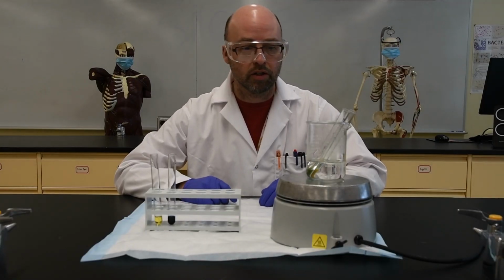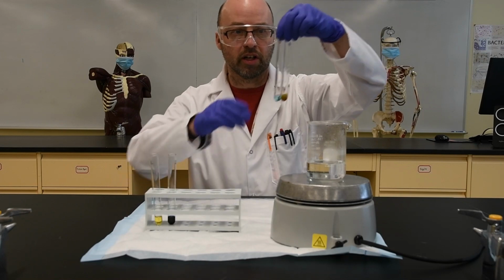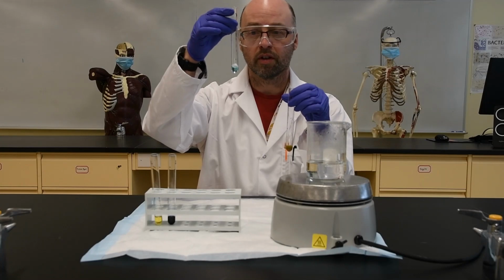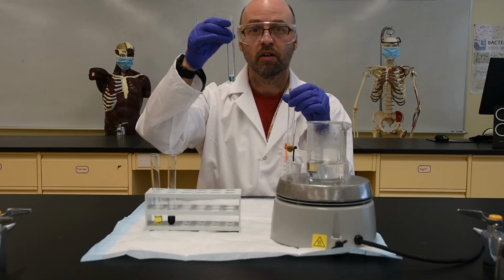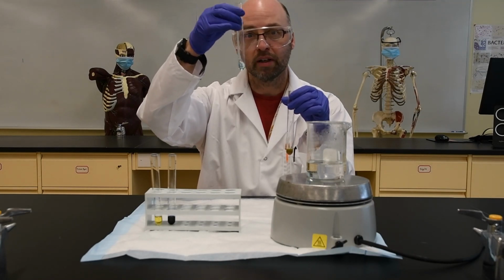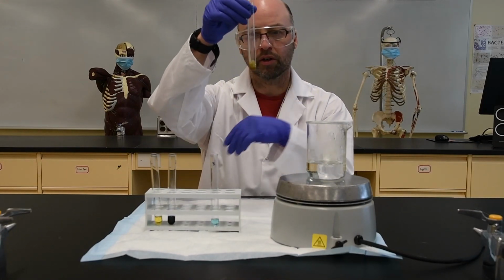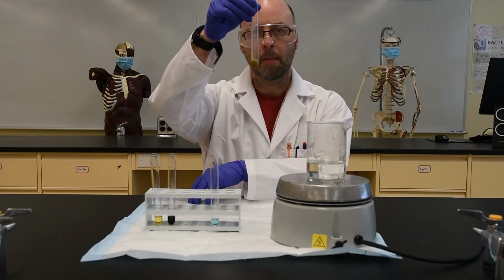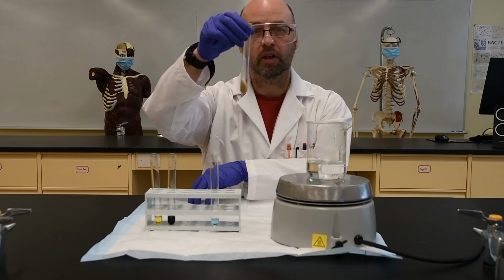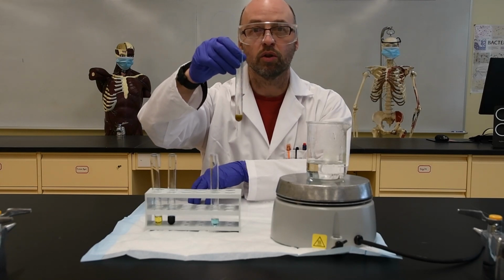Okay, so the tubes have been in the water bath, boiling for a little while, and you can see that there's been a color change. Let's just have a quick look. There's the negative control, the negative result for Benedict's for glucose, so it remains this nice light blue color. And the positive glucose test with Benedict's, you can see it's this kind of muddy, greeny brown color. So in a second I'll show you a little bit closer so that you can record the results of the 4 controls into your table.